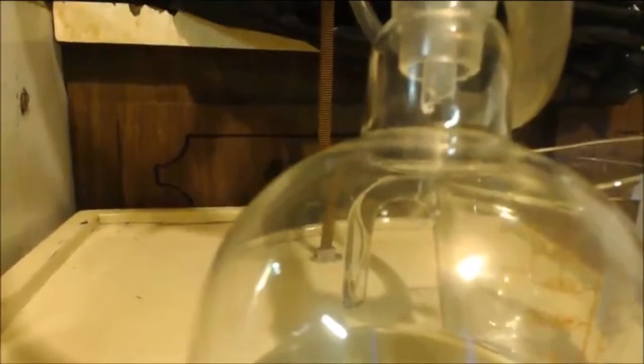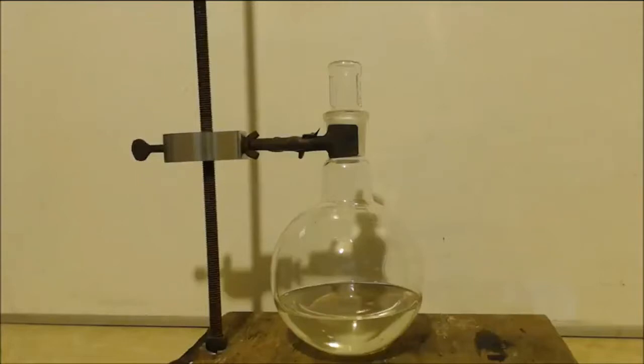I'm just tired of distilling. I just want to quit. Plus the drip rate slowed down. Oh, it's pretty much stopped now. Jacked up the heat. There it goes. Alright, I'm going to do this maybe a couple more minutes and I'm going to call it a day. Well, there's my stuff.